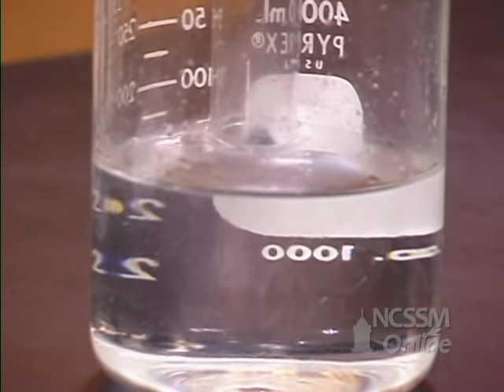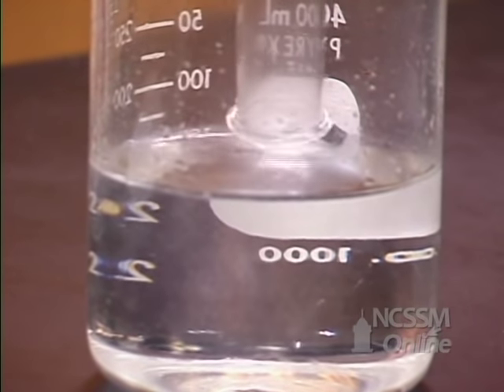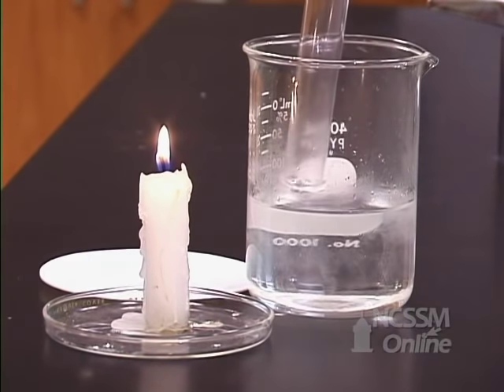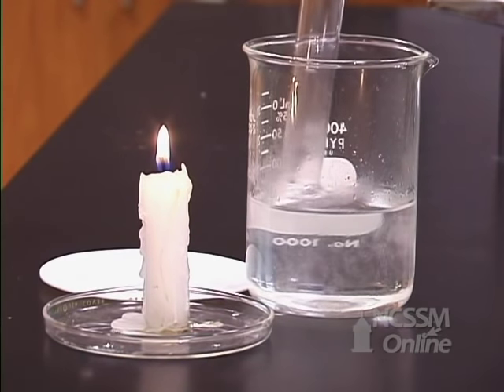If we trap some of the gas in a test tube, we can test that the gas is actually hydrogen by testing its flammability.